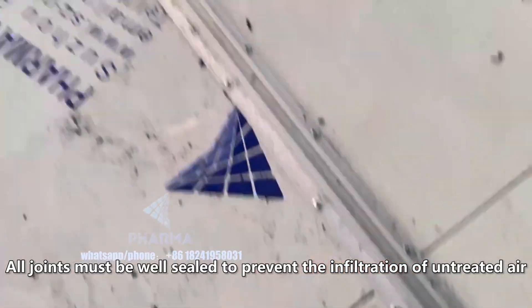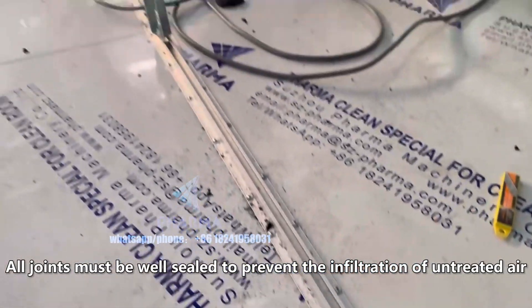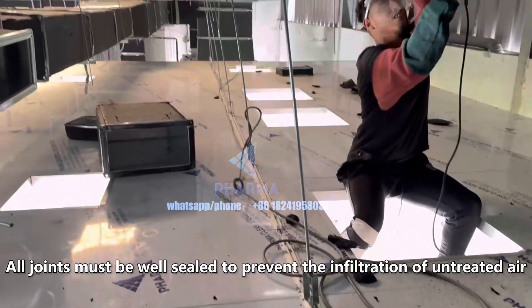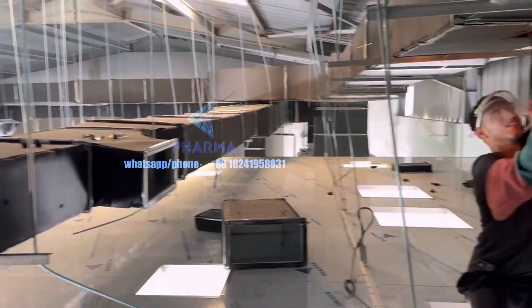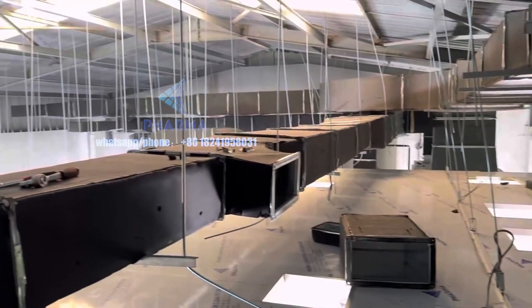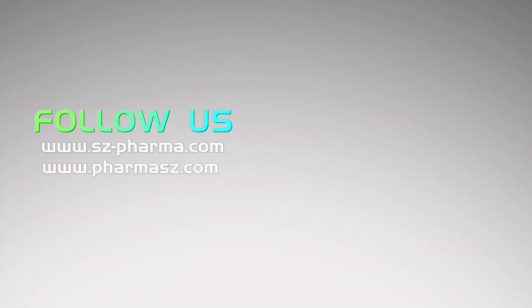All joints must be well sealed to prevent the infiltration of untreated air.